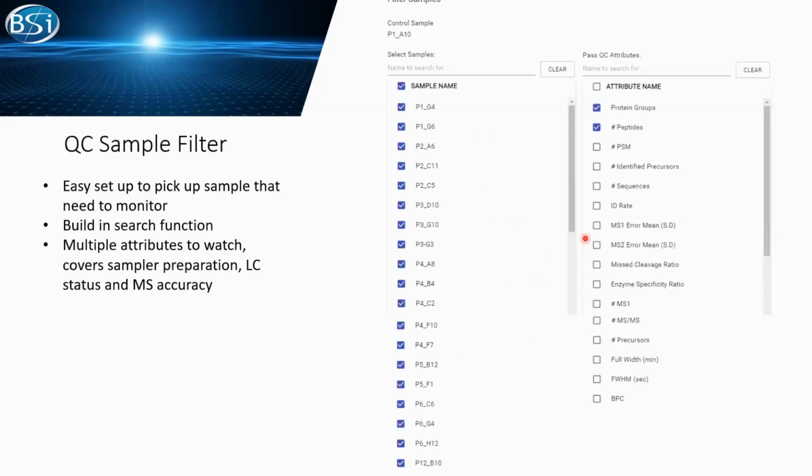The first thing we do is set up a control sample, which can be set in the setup page. Also, you can pick any samples that you would like to watch. Here, all 20 samples are selected. But imagine if you have a much longer sample list, you can use the built-in search to quickly select the data you want to watch. We will show this function again in the demonstration.